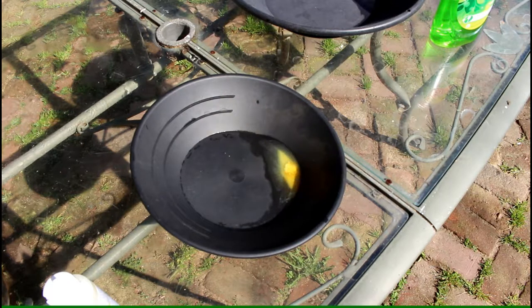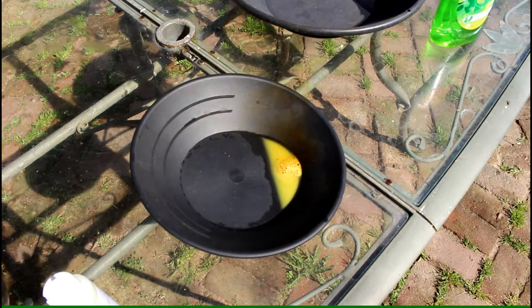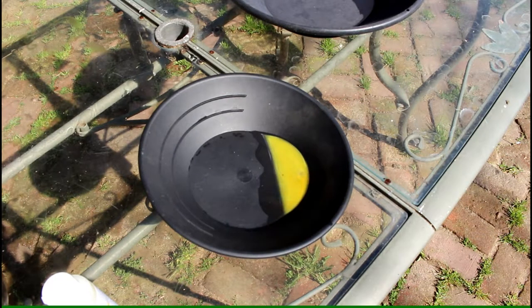That reaction you're seeing is the nitric acid dissolving the mercury. The mercury will become in solution in your acid, and when that process is all done we will have our ball of sponge gold — for lack of a better term. It'll be dirty and we still have to clean it. I'm going to shut the camera off and go get a drink while this is going on.